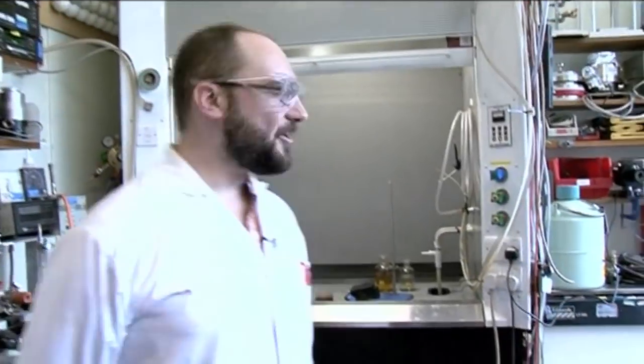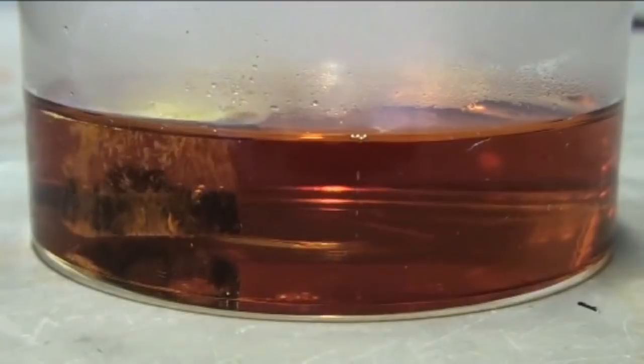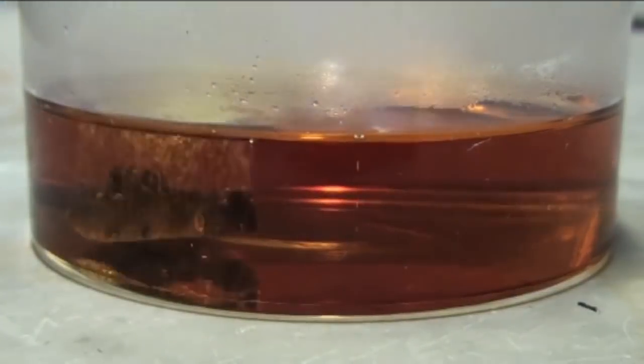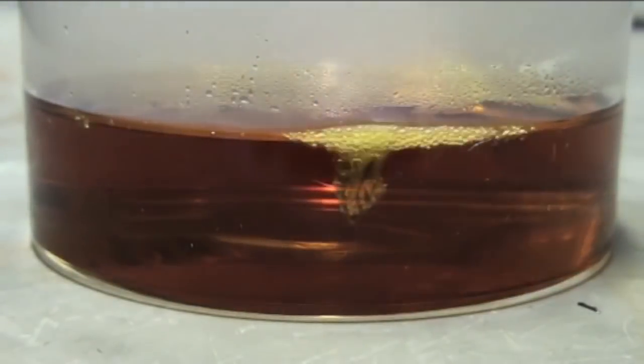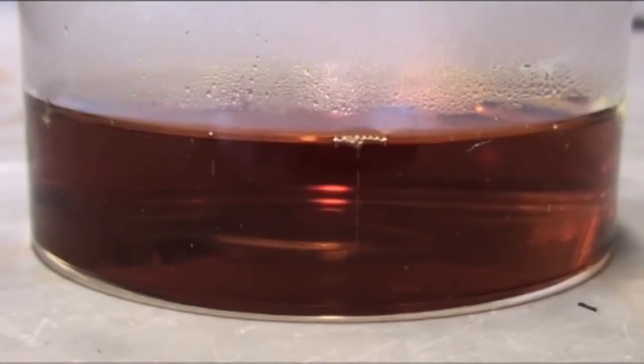As the gold dissolves, what we wind up with in the evaporating dish is chloroauric acid. I thought it was going to be way more violent than it was. I thought we'd leave and come back and not know if someone had just taken it. But no — that thing bubbled and struggled for its life and flopped around like a dying fish. It was almost kind of sad.